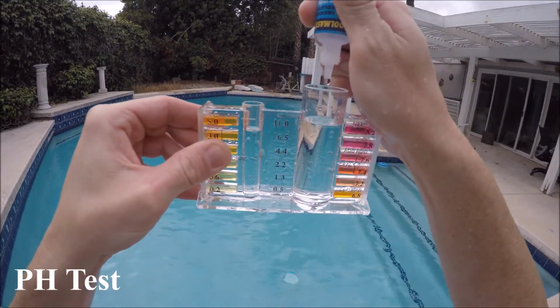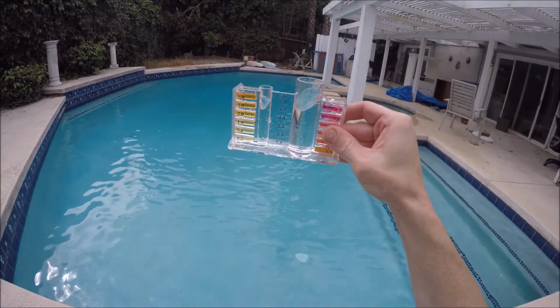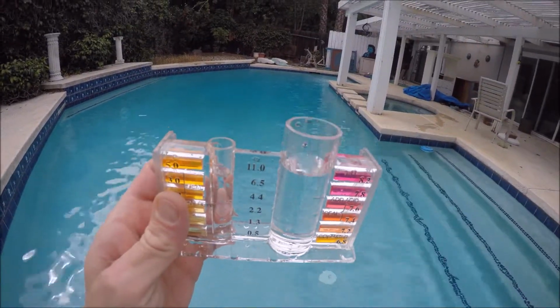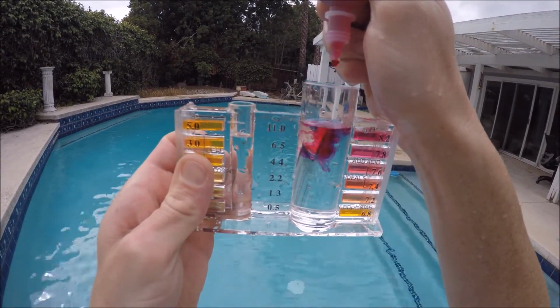We begin by adding 2 drops of the number 4 reagent, which is the chlorine neutralizer, and then swirling the solution. Swirling without spilling does take some practice, but we will go over how to do it without spilling later in the video. Next, we add 5 drops of the number 2 pH test reagent.